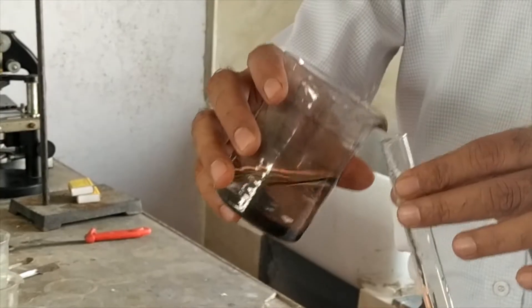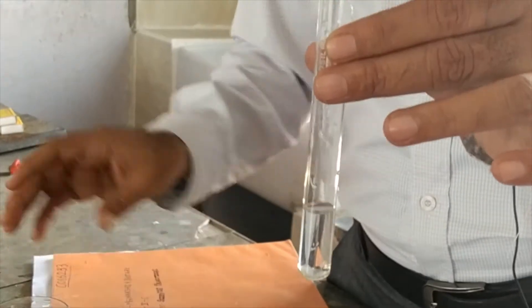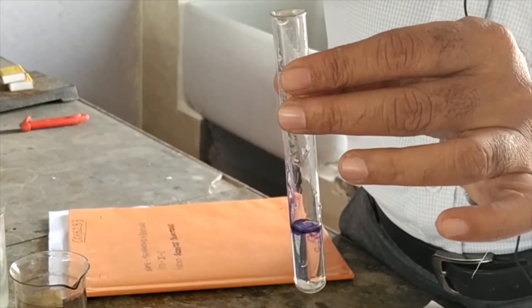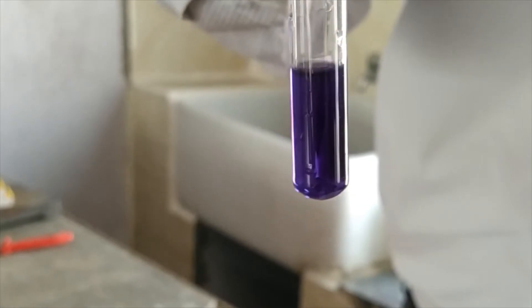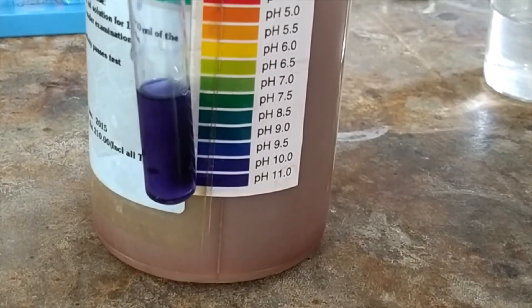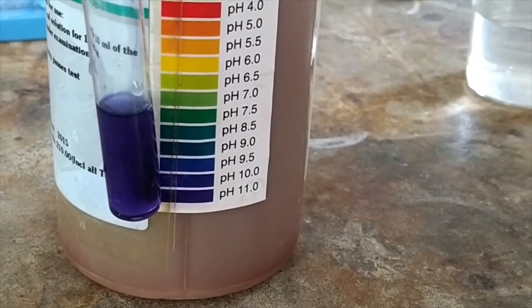Now let us take the second solution — NaOH, sodium hydroxide. This is dilute sodium hydroxide. Again put 2 or 3 drops of the universal indicator. See the color change — this is purple in color. Now let us see what is the pH. The pH of the solution is 11. This is purple in color, so pH is 11, and this is a basic solution.